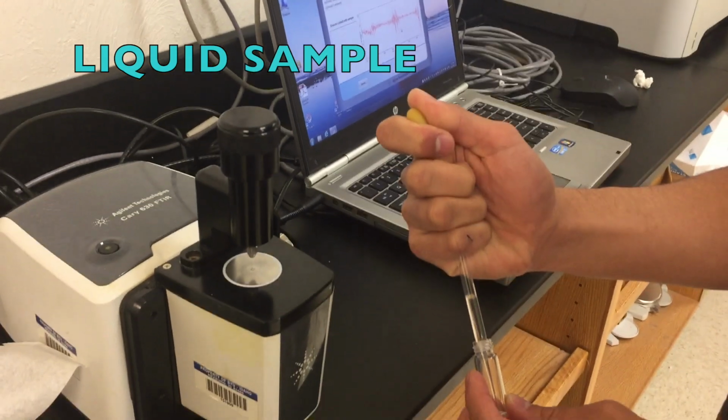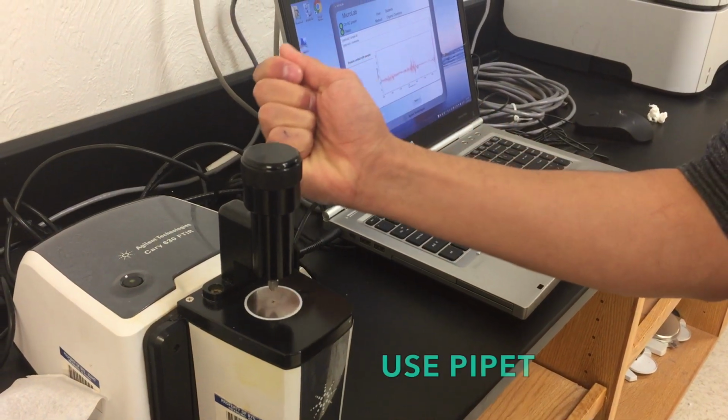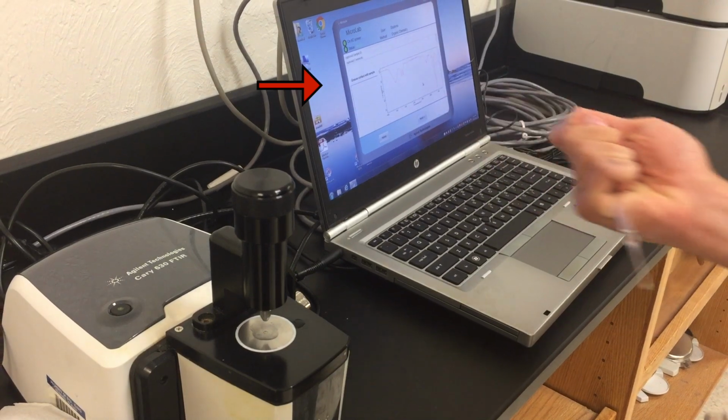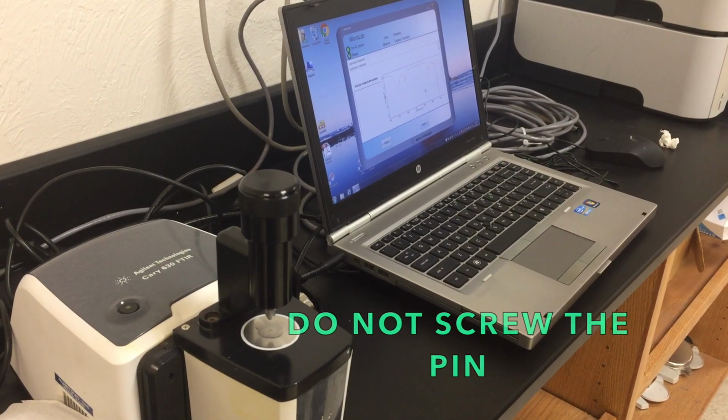When you have your liquid sample, use a pipette and place a few drops of your sample quickly before it evaporates. Notice that the spectrum on the screen changes as you place the sample. You don't need to screw down the pin.